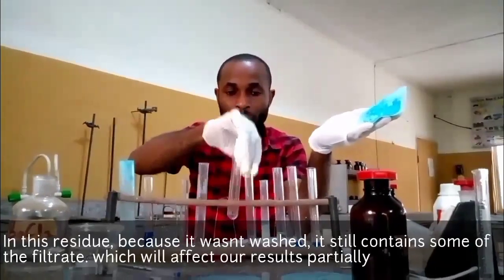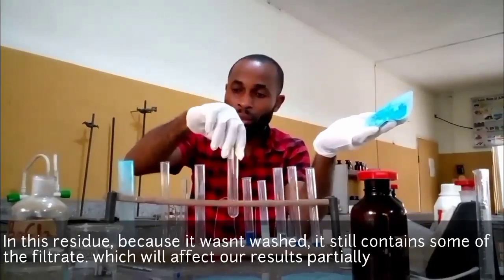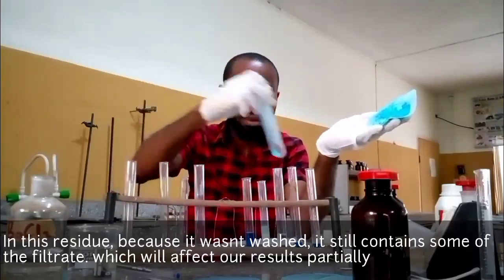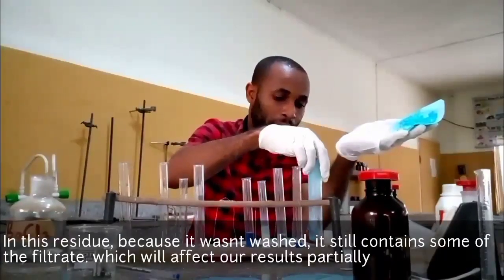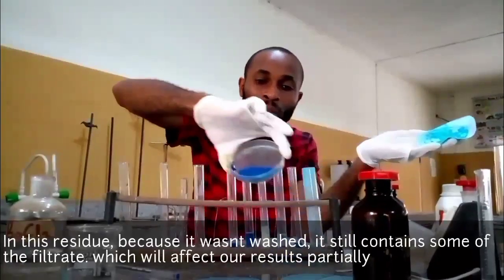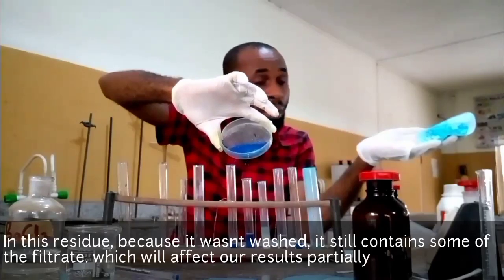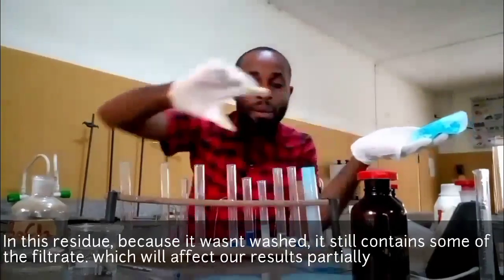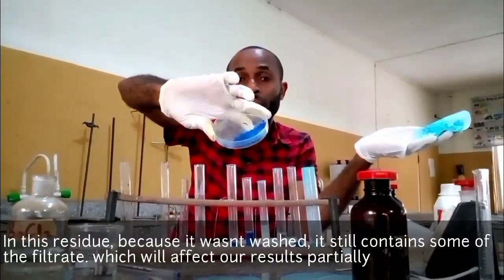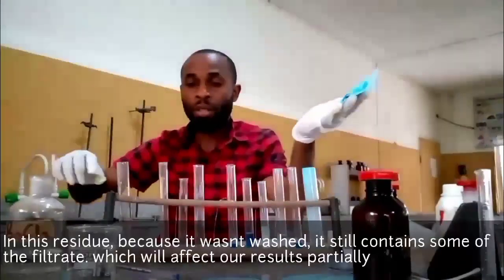I hope you can recall everything I have done. Okay, I'm picking this out. Now let me bring to your notice again about the salt. The color is changing, going towards blue, deep blue. As I said earlier, probably in your exam, this might be the one you will see. If you see this, don't panic. It's the same thing you are going to observe when we are done.